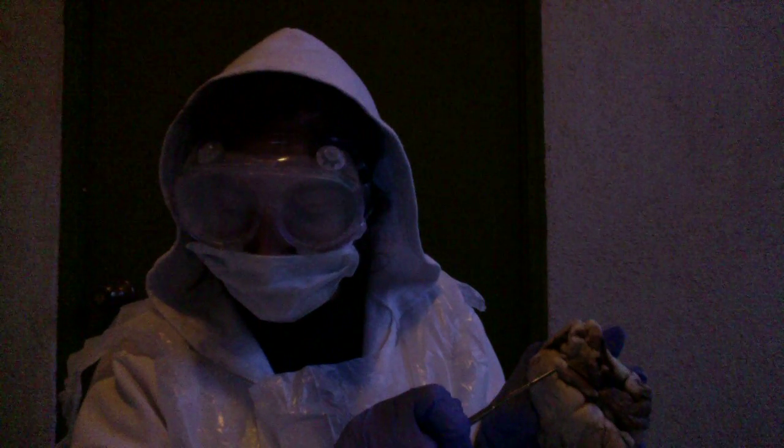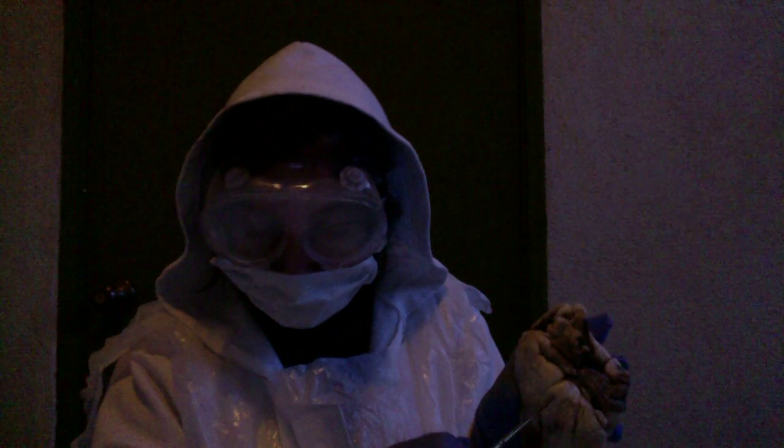The ascending aorta is in here. The aorta is the main artery in the human body, originating from the left ventricle of the heart and extending down to the abdomen, where it splits into two smaller arteries. Oh, I said that already, didn't I? I'm sorry, I'm confusing myself. The brachiocephalic trunk. Let me try to get closer there. The left common carotid artery and the left subclavian artery.